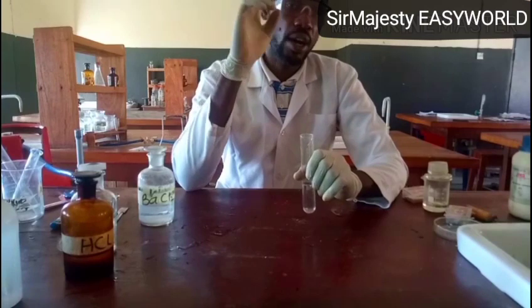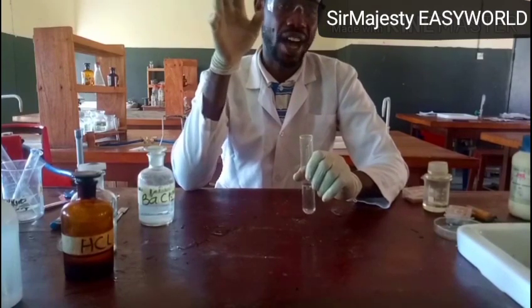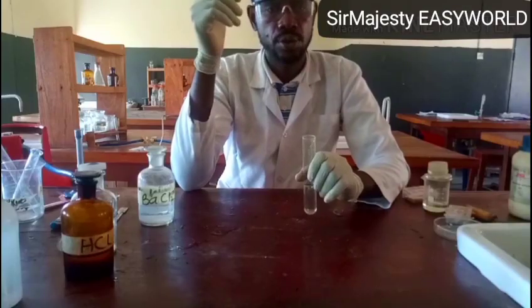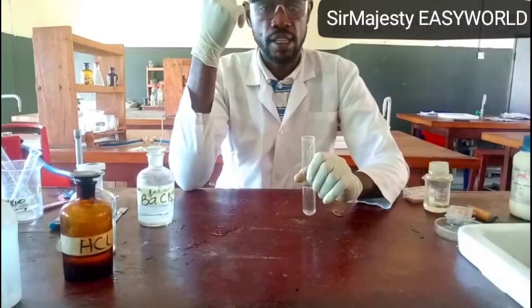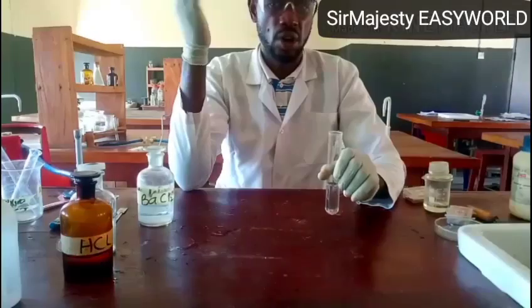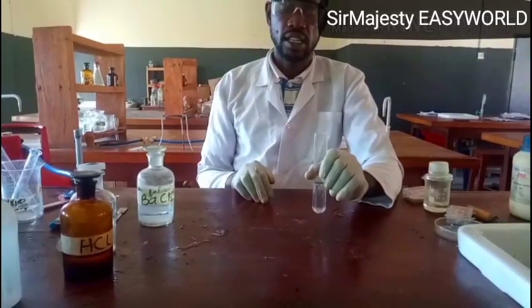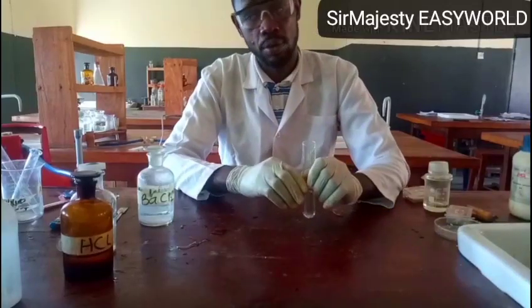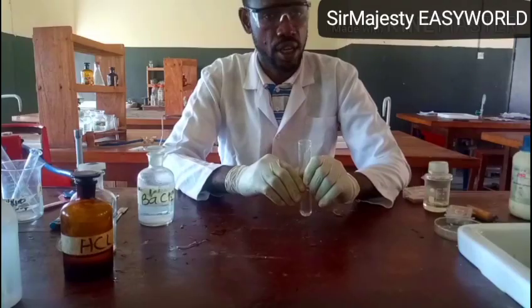For your exams, the examiner will not tell you what to use to confirm your gas. The question will just tell you to identify any gas or gases evolved. So it is left for you to be very cautious and test for any gas. Some might say there is no lime water in the specimen the examiner provided. No, it's left for you to keep them around. When I started, I showed you I have my glass rod and my litmus paper. There is also lime water around, but I don't have the mechanism to bubble it because I've done that video here on this channel.